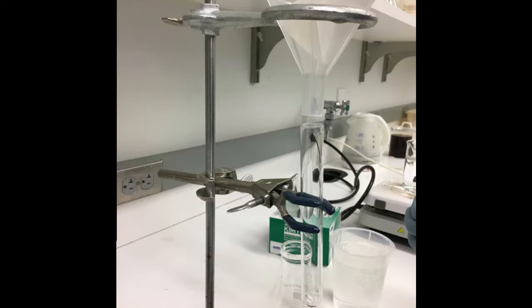In the meantime, set up a funneling system by attaching a ring clamp to a ring stand and then securely placing a funnel in the center of the rig. Place a clean test tube below the funnel so that it captures all the liquids coming out of the funnel stem.